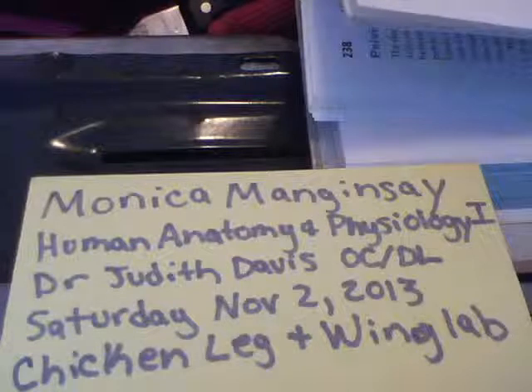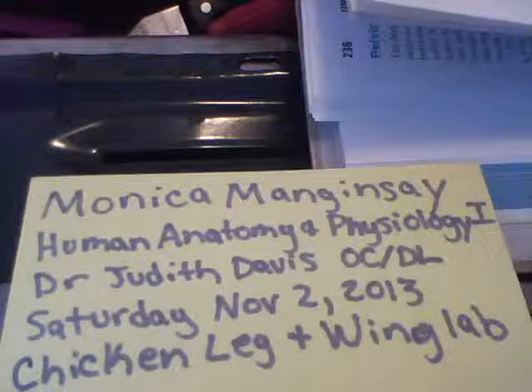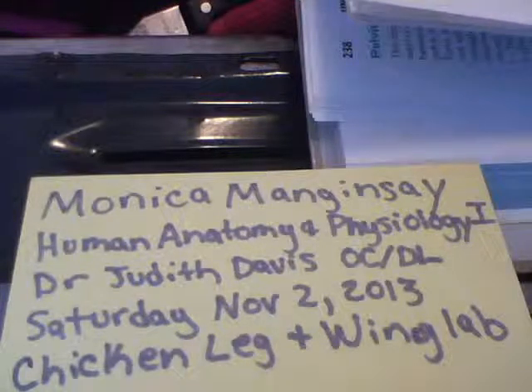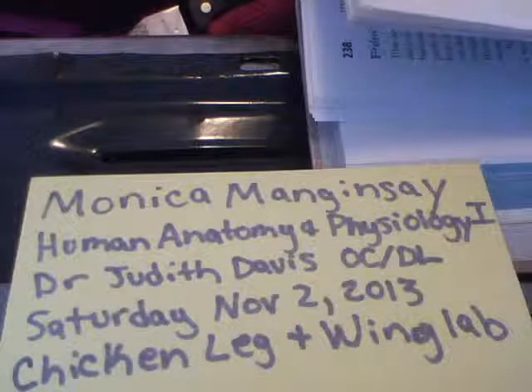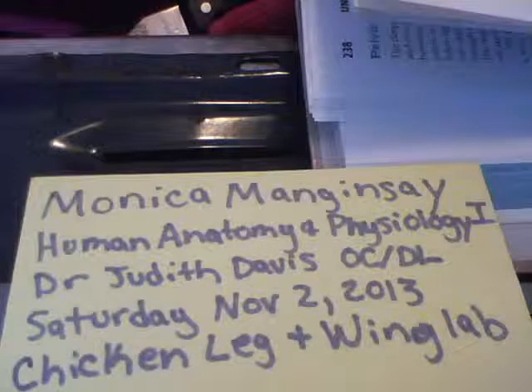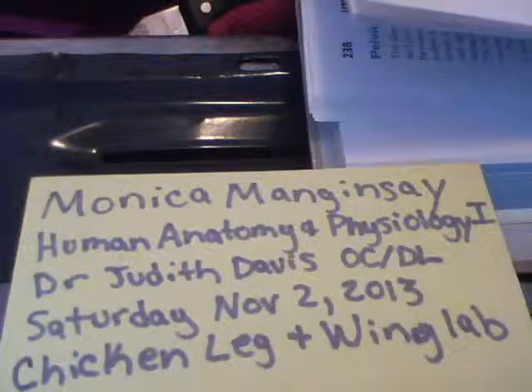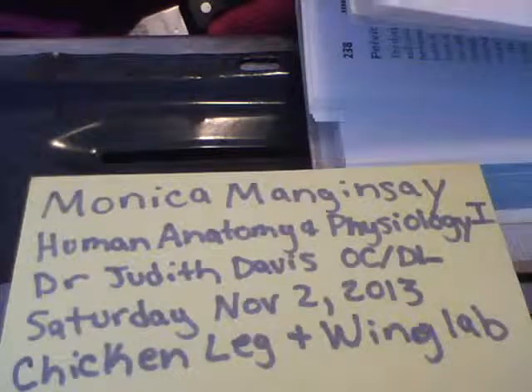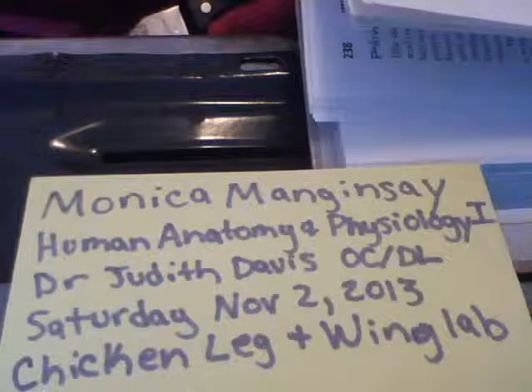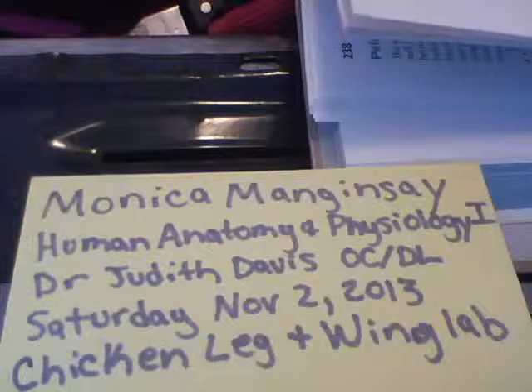Synovial fluid. A small amount of slippery synovial fluid occupies all free spaces within the joint capsule. This fluid is derived largely by filtration from blood flowing through the capillaries in the synovial membrane. Synovial fluid has a viscous, egg-white consistency due to hyaluronic acid secreted by the cells in the synovial membrane, but it thins and becomes less viscous during joint activity.